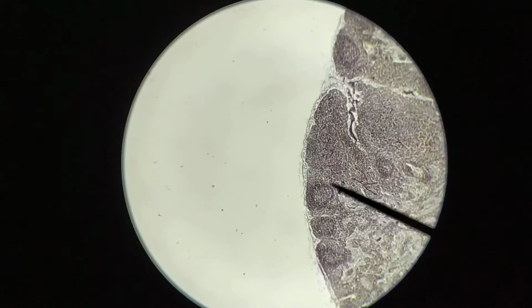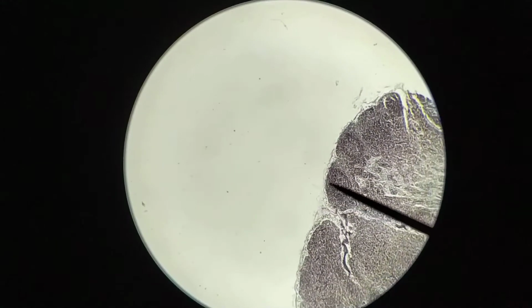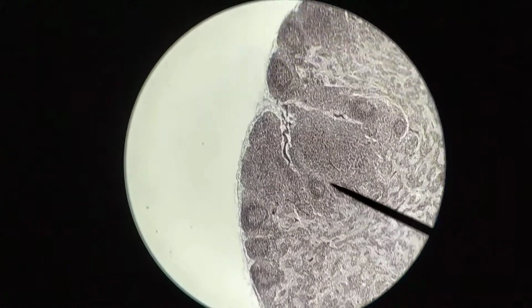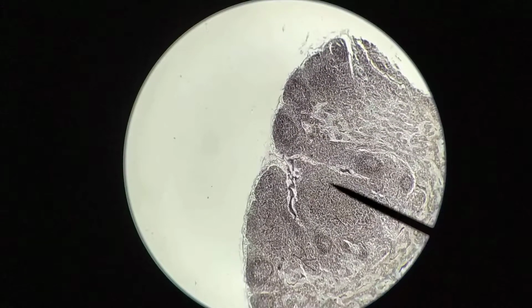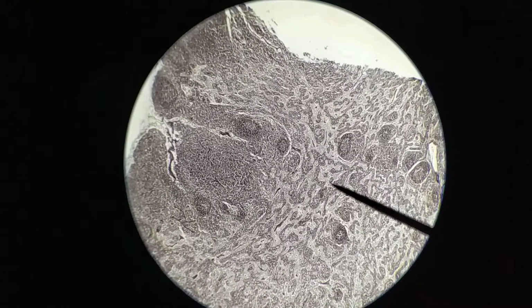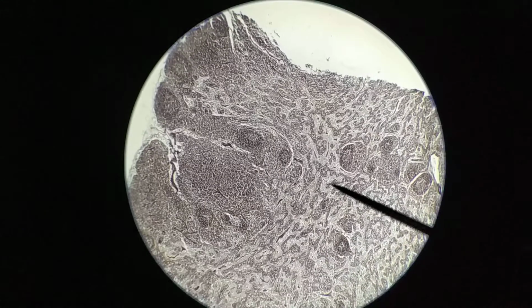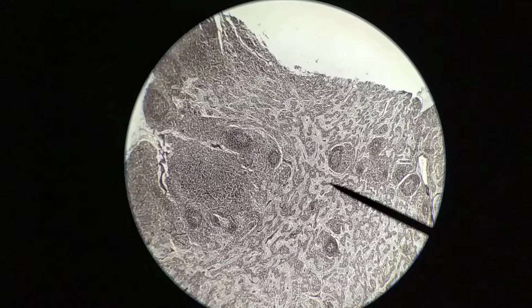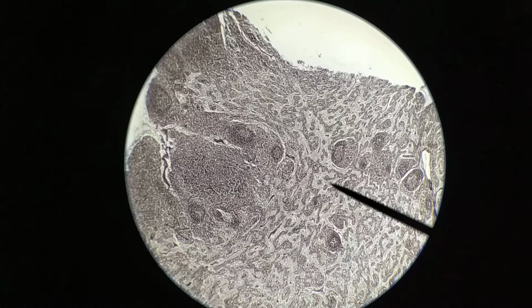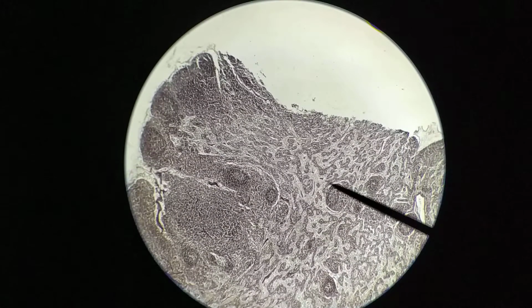Okay, so again, the overall organization of a lymph node is still quite clearly visible here. We have the lymphatic nodules along the outer region. This is again the cortex. Okay, we have some of these regions that are a little bit less organized. That's the paracortex, and then we have these regions in here in the middle with kind of these random looking lighter passages and darker areas. This is the medulla, and so we have medullary sinuses.